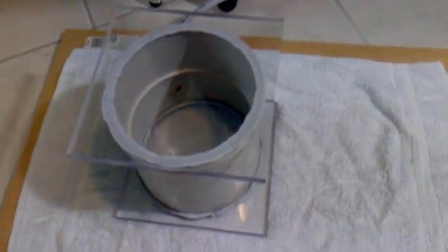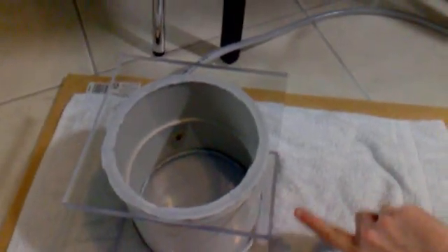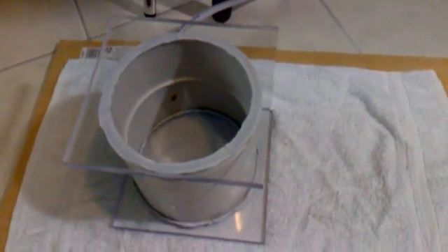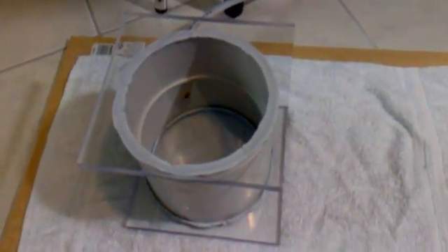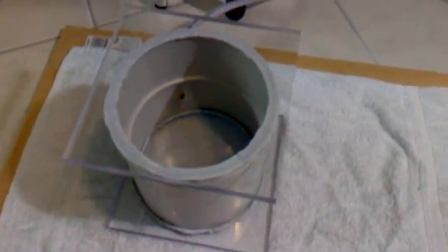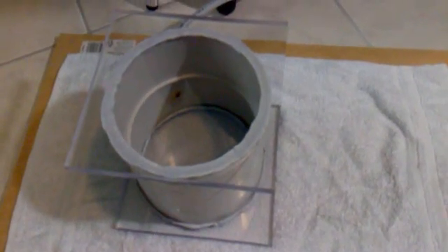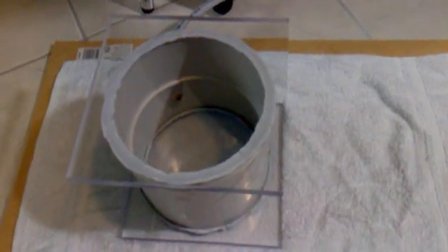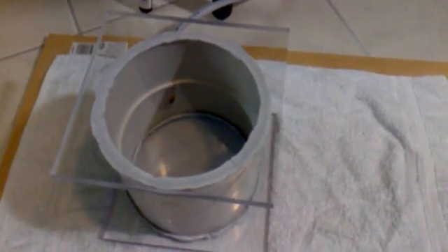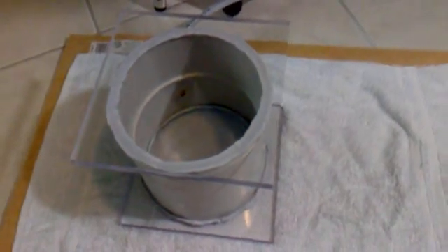chamber. Basically the chamber wall around the outside is just PVC tubing from a hardware store. It's about 2 millimeters thick in some places and about 4 millimeters thick in others. For the transparent top and bottom, I've got 20 centimeter wide sheets of 12.5 millimeter thick polycarbonate, and it's more or less indestructible. I'm more worried about the PVC on the side here. It's much more likely to be the cause of failure if this implodes.